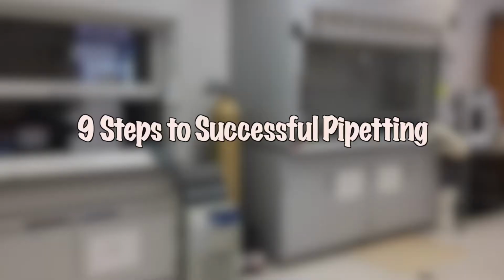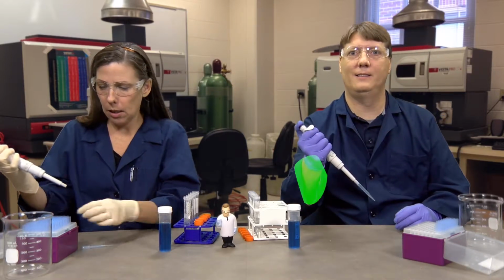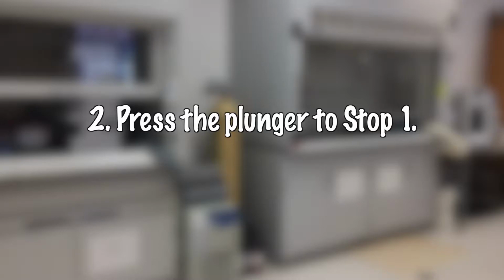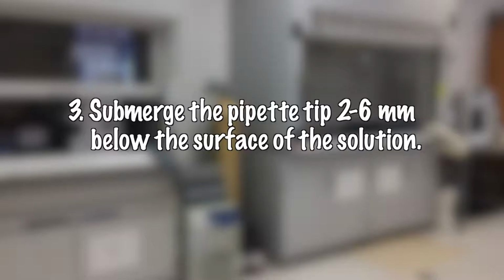9 steps to successful pipetting. Step 1, choose the correct pipette tip and secure it tightly onto the pipette. Step 2, press the plunger to stop one. Step 3, submerge the pipette tip 2 to 6 millimeters below the surface of the solution.